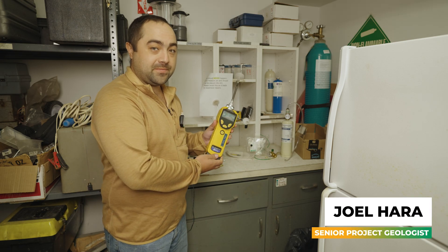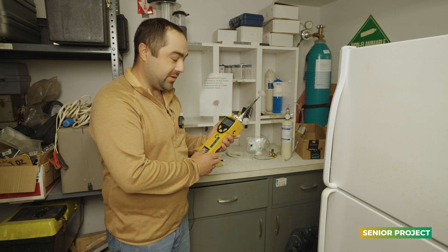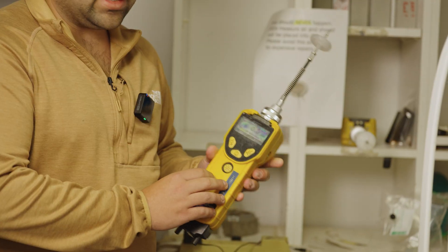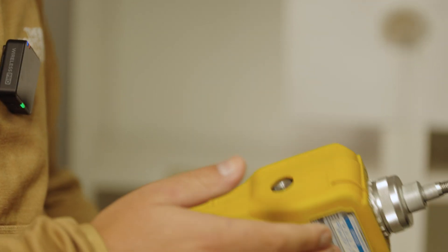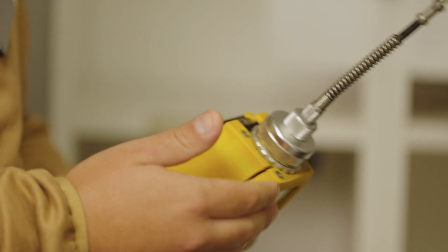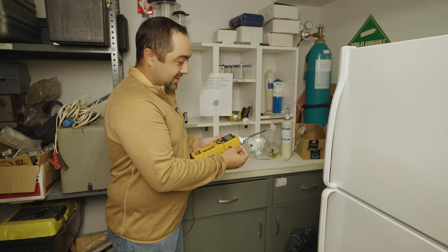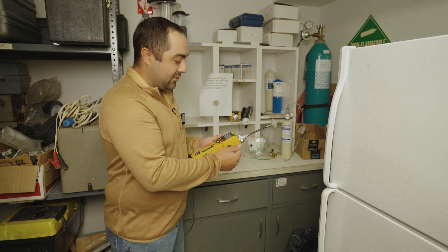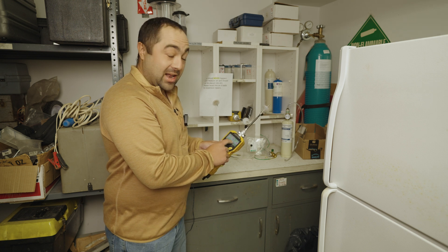So this is the PID. It is a field tool that geologists and field staff use out in the field to make decisions on the fly. PID stands for photo ionization detector, and there's an ultraviolet lamp in here that sucks in air through this end. The air runs over the lamp inside there. The lamp takes VOCs — the electrons of VOCs in the air — breaks them down, sends them up, makes a current out of it, and the current is what you get the reading on here for.